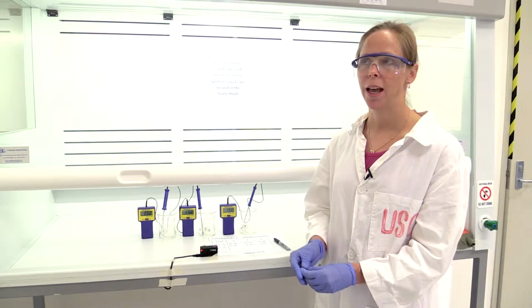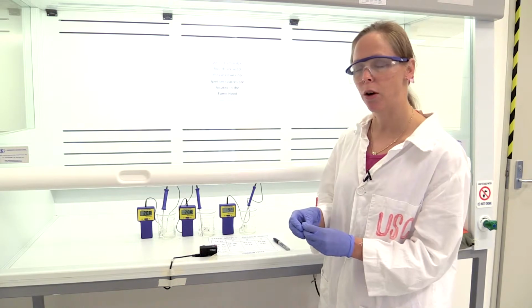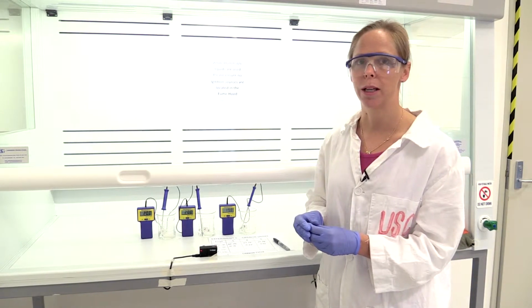So you'll see with our carbon sequestration reaction later that this is an example in the laboratory of how to do something, and the industrial scaling up of this process takes a fair bit, especially when you're involving chemicals like sulfuric acid, which is quite expensive in this example, and later sodium hydroxide, which is quite expensive.